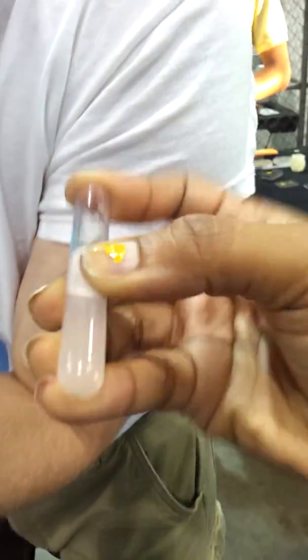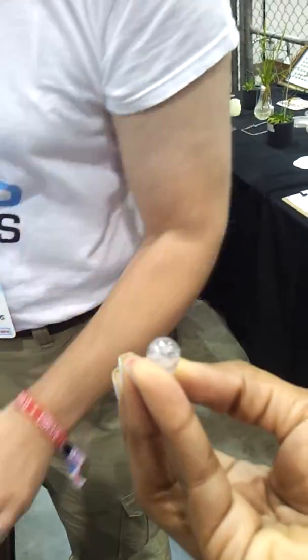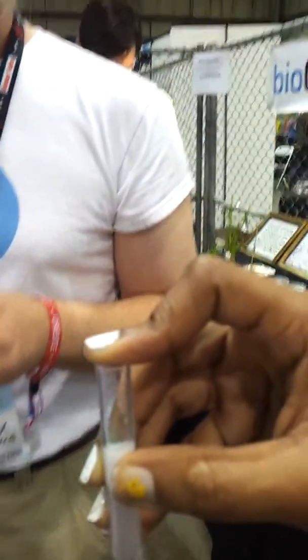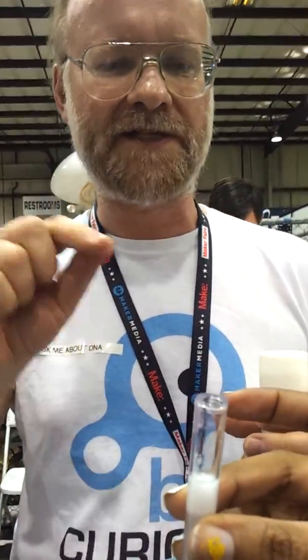But you do want to mix in the... You're not eager to do any more spitting, are you? We'll go ahead and we'll see what happens. So just put your finger on it and go back and forth a couple of times. That'll be plenty. Is that good? Yes. So right now the DNA has actually come out of the cells. The cells have broken up, but the DNA is still soluble right now.